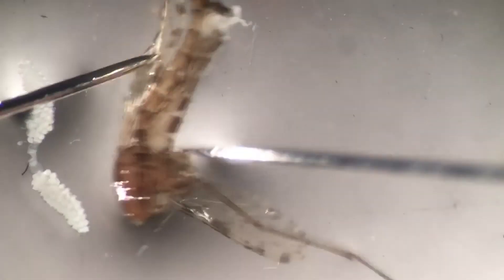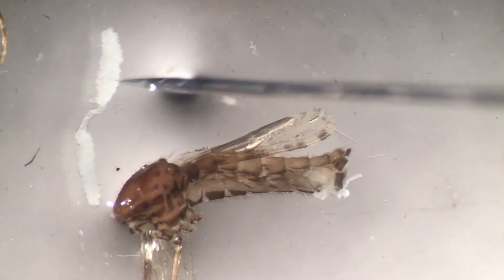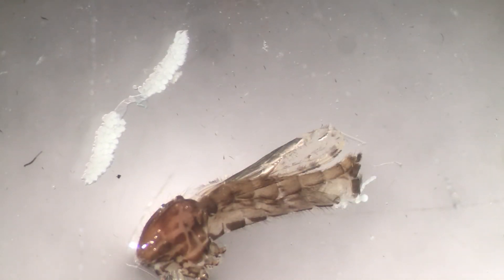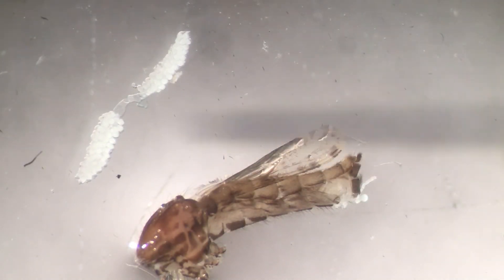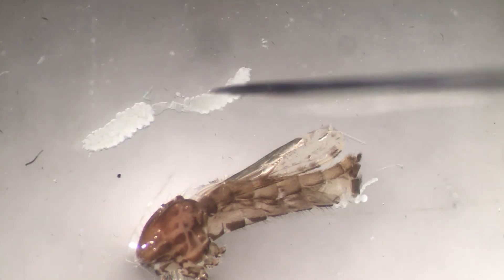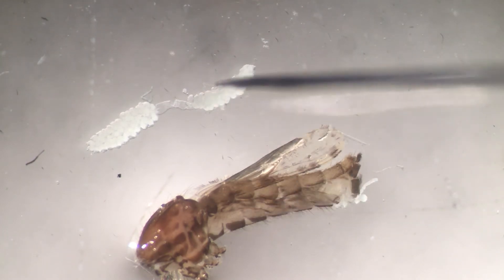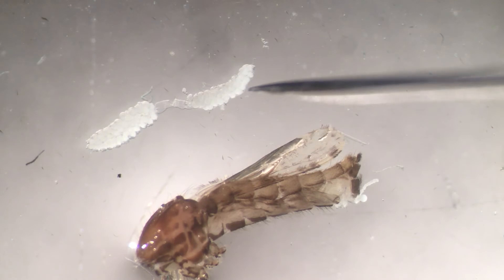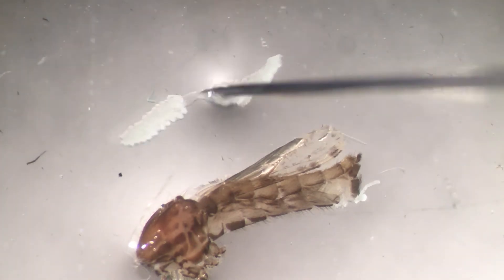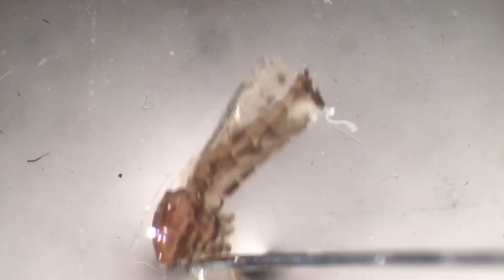Another important organ: these are the ovaries. You can see they were tiny before the female started to feed - maybe one-fifth of the size - but now in just a couple of days they've grown a lot. Had the mosquito been alive for a few more days, they would have increased their size significantly and turned into actual eggs.